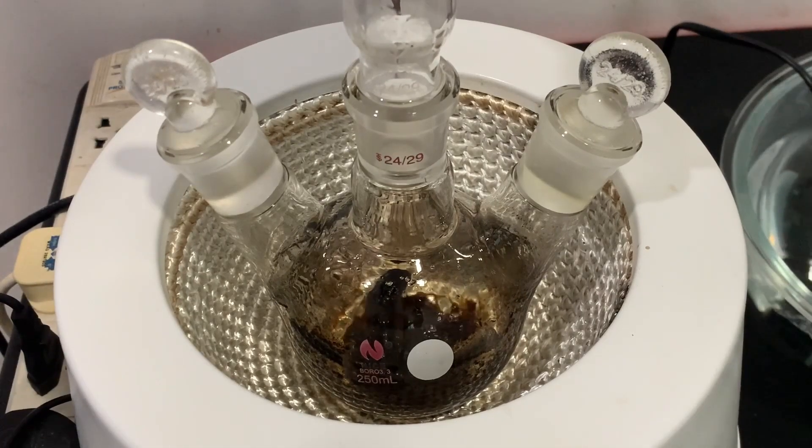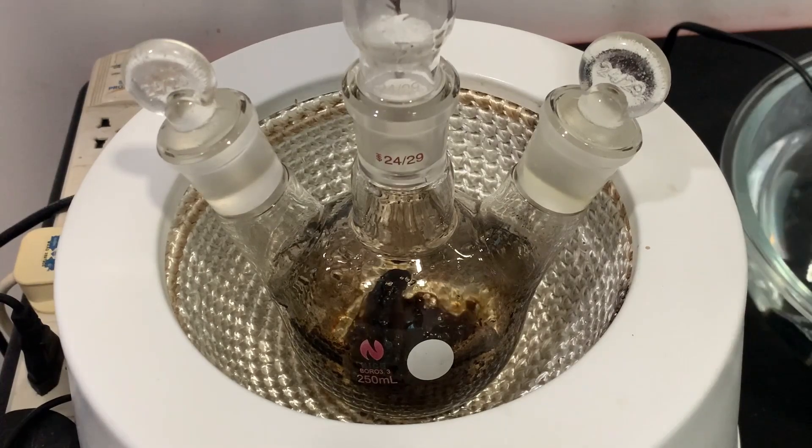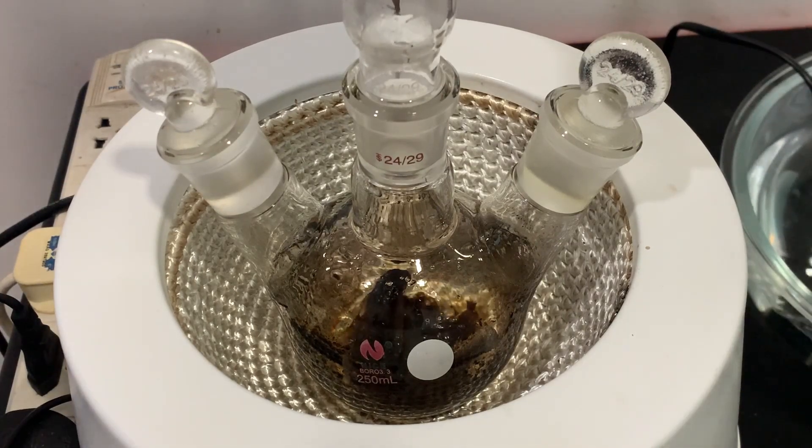When there was barely any liquid left in the 250 milliliter flask, I turned off the heating mantle and let everything cool.